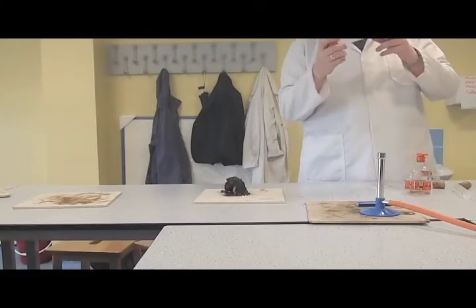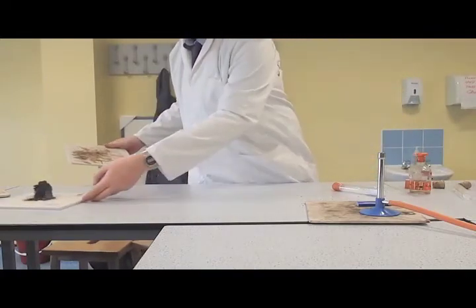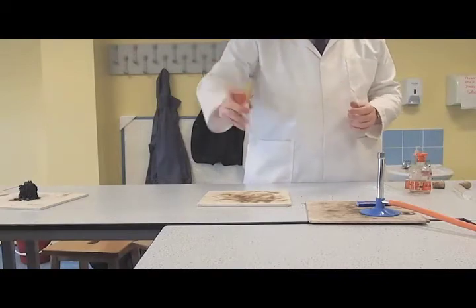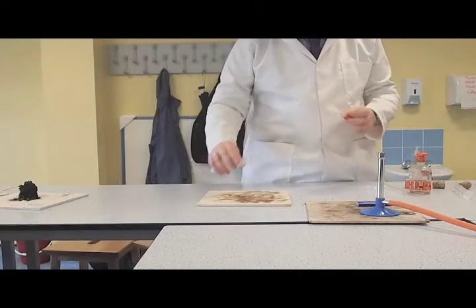Okay, so last but not least, if I ever get it mixed properly, is going to be our copper. So I'll move our lithium out of the way. It's just been a burnt sugar, because the sugar is the source of hydrocarbon in there. It smells like that toffee caramelly stuff.